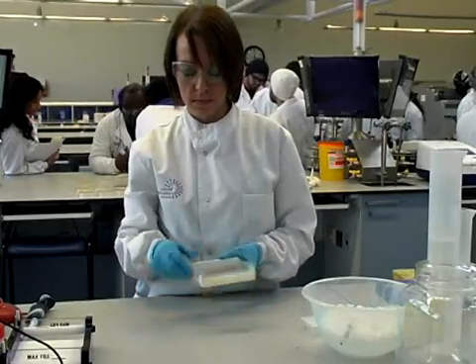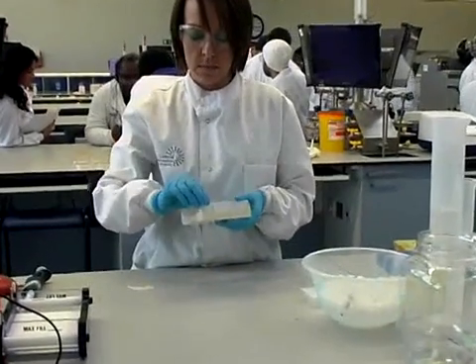Once the gel has set the tape is removed from the ends of the preparation.